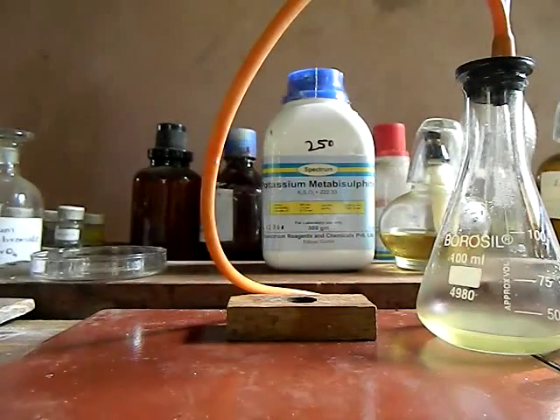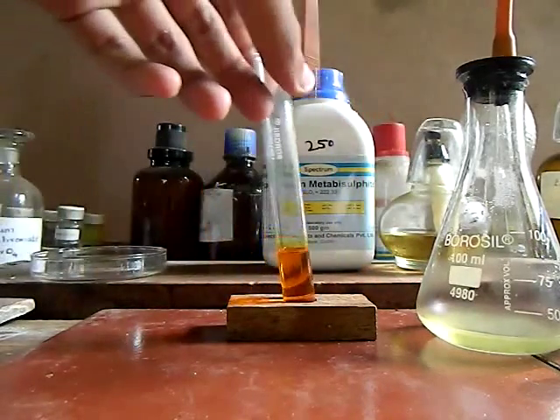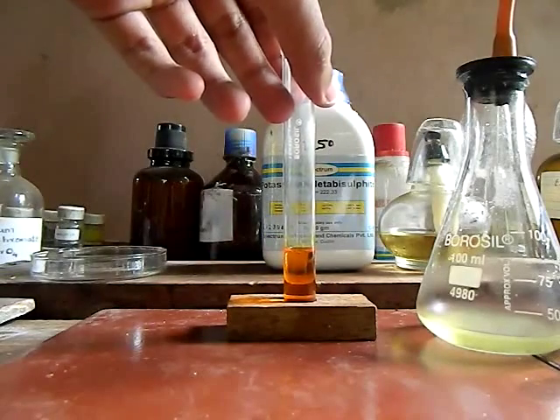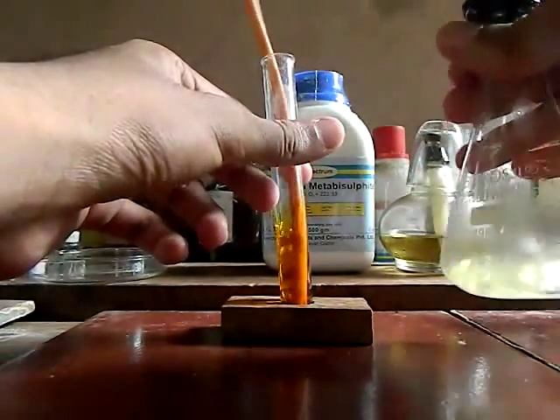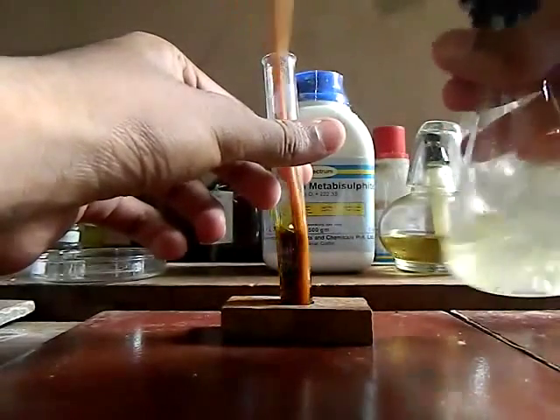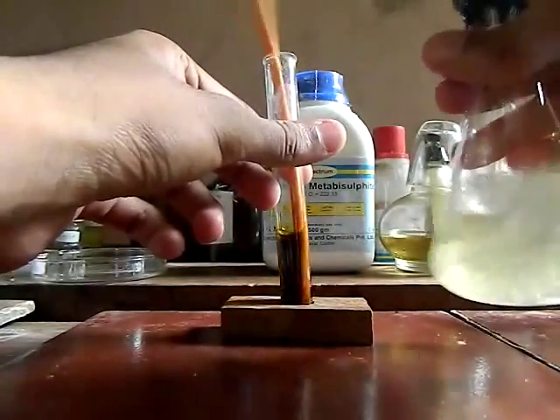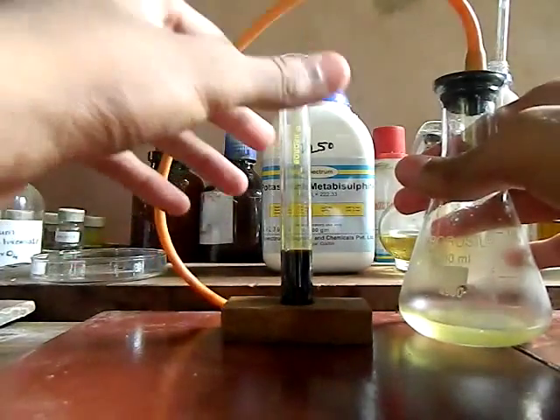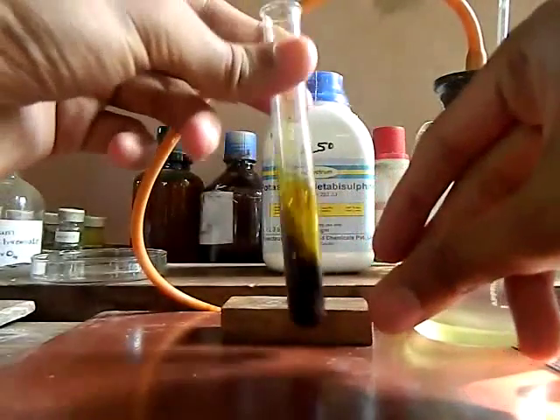Now we take potassium dichromate solution. You can see its bright orange color. We do the same as we done before. Here you can see the color changing dark, then it becomes dark green. You may feel it's like black color but still it's dark green.